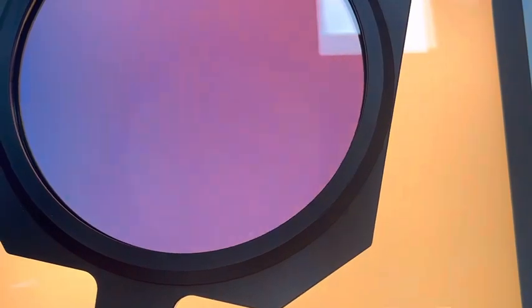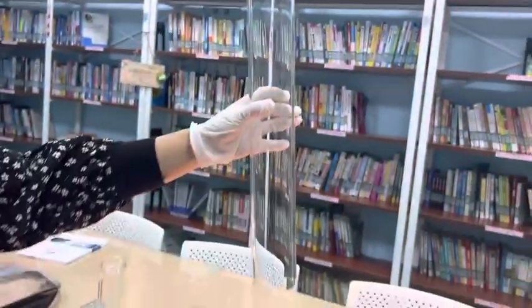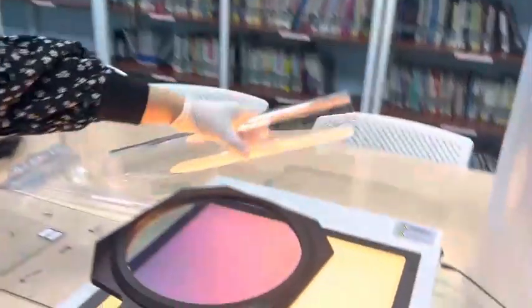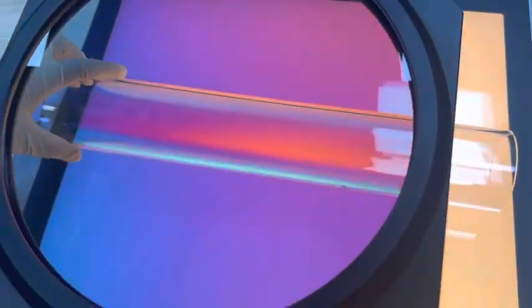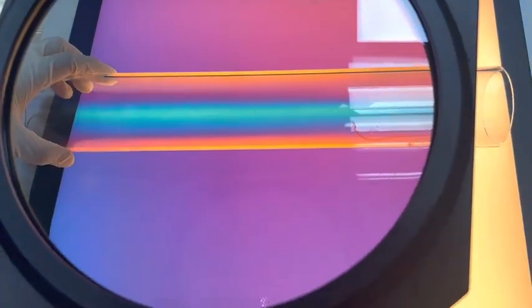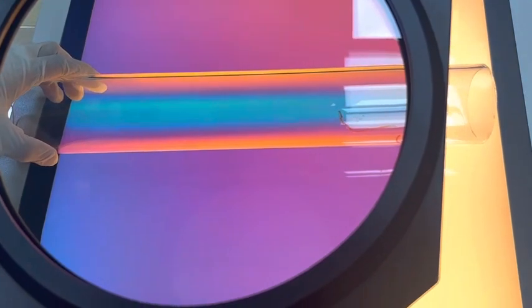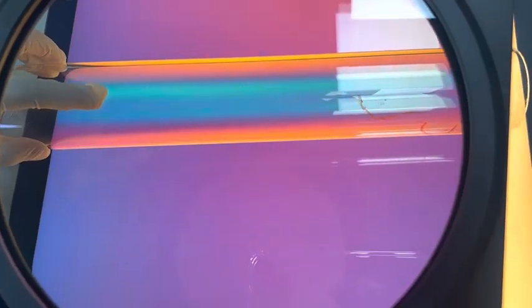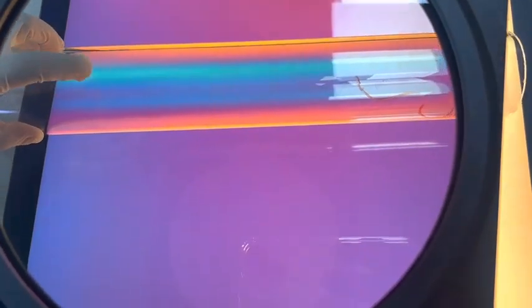Let's turn to a glass tube. Let's try to find the stress-concentrated areas like this blue area.